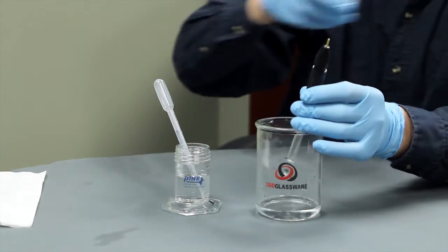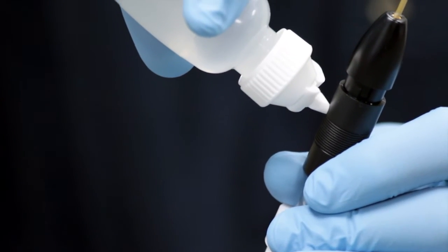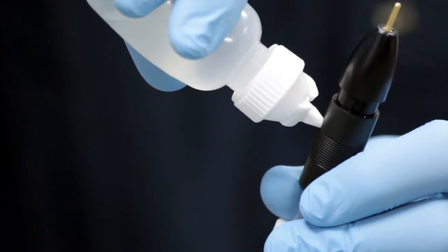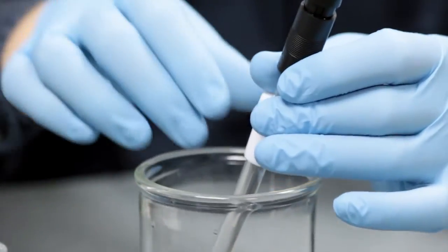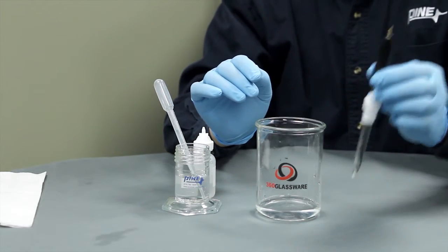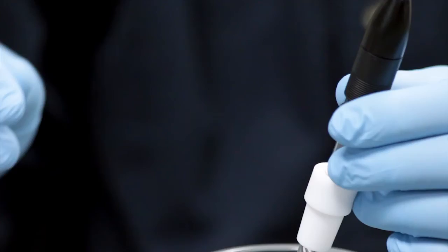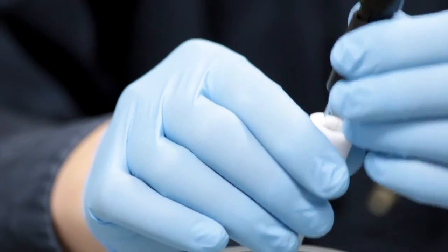Next, you will want to rinse the inside by filling the glass body tube with pure water or filling solution. You may have to shake it a few times with the sliding door closed to get it cleaned. After the tube is rinsed several times, make sure that all the solution inside is drained completely.